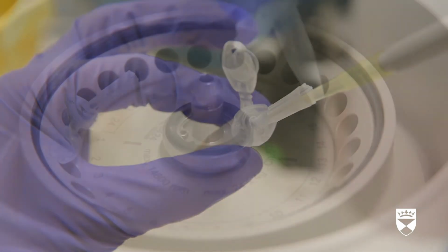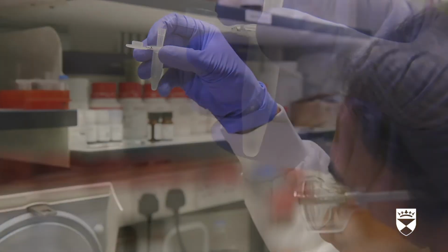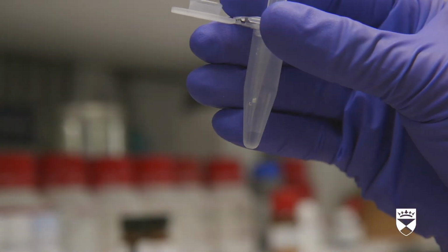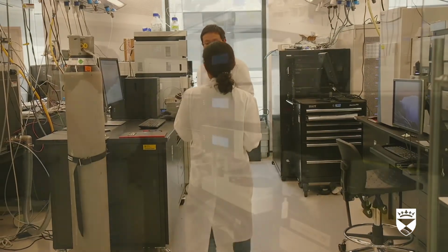The mass spec is extremely sensitive to salt, so we need to remove salt from the sample. The scientist carries the samples into a room where another scientist works. The other scientist places the samples into the mass spectrometer. As the machine operates, they discuss data displayed on a computer. Later, the second scientist sits in an office and reviews data on another computer. We are now ready to place the sample into the mass spec.